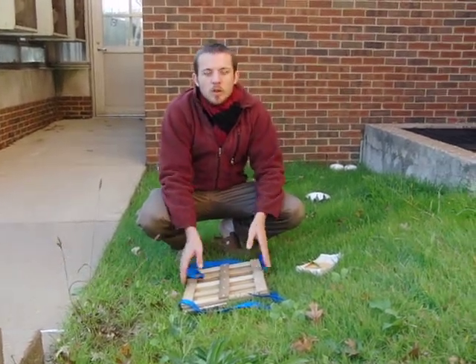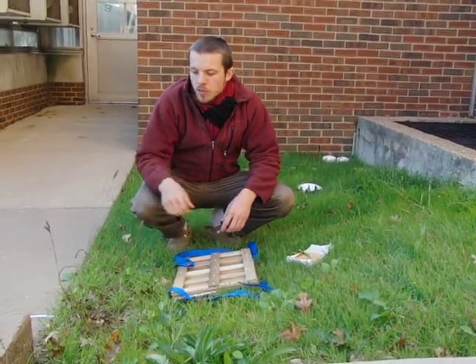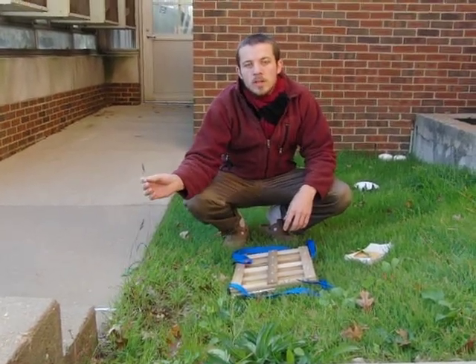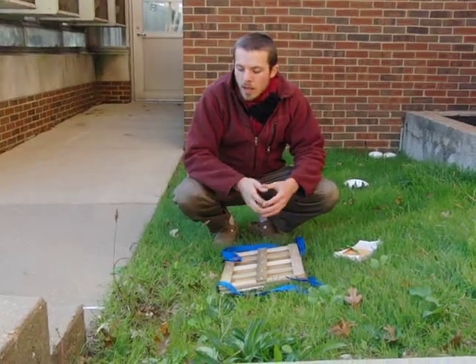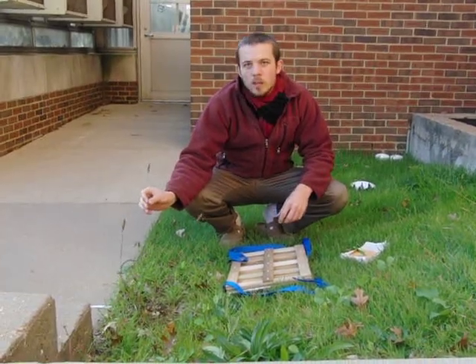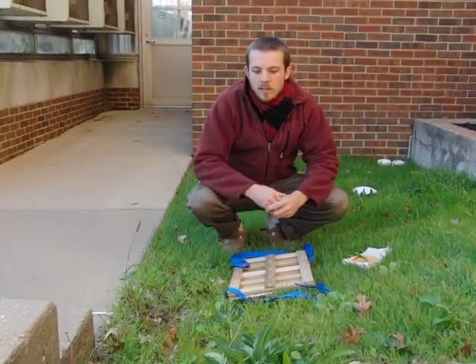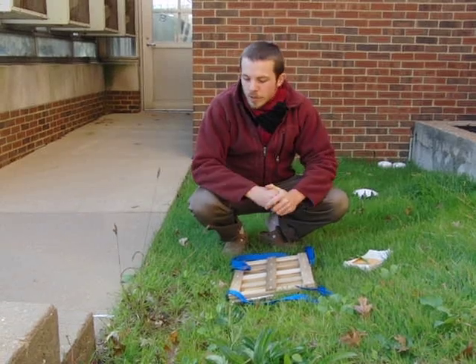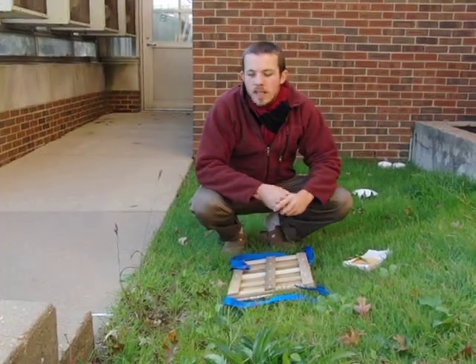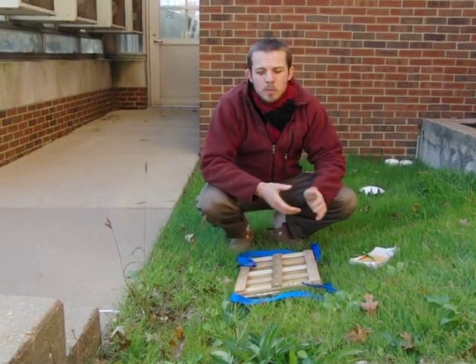Hello! We're shooting a short video to show how to collect plants. Setaria viridis, which we have here, is becoming a model organism for studying C4 photosynthesis. With an increase in interest among geneticists, we've had a lot of people asking what to do to collect it, since some geneticists don't have exposure to that branch of biology. This video will show how to collect a plant, how to record the data, and how to collect seed for germlines and population genetic studies.